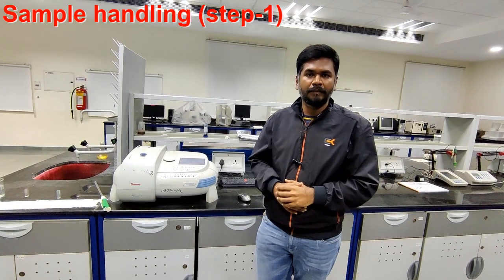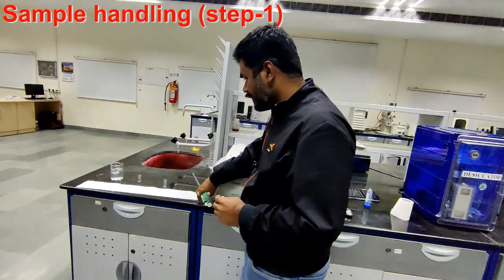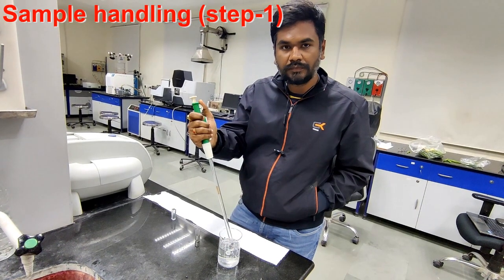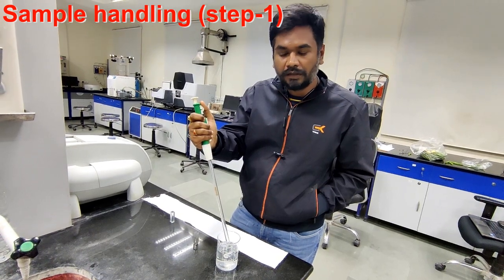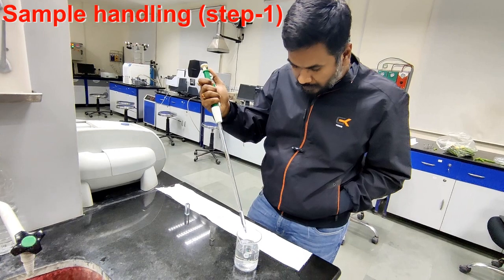Now I'll explain the sample measurement. In this sample measurement, first we load the blank sample in both the cuvettes. Here I'm using a pipette for filling distilled water into both the cuvettes.